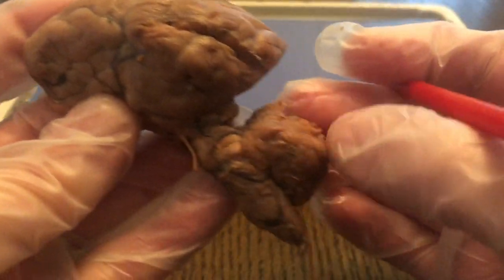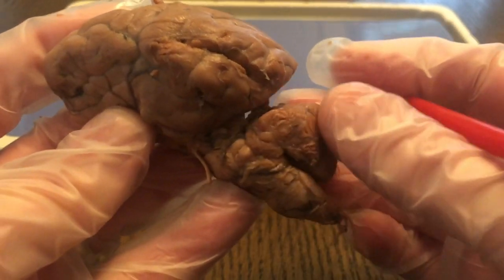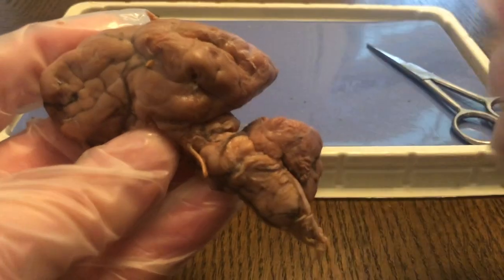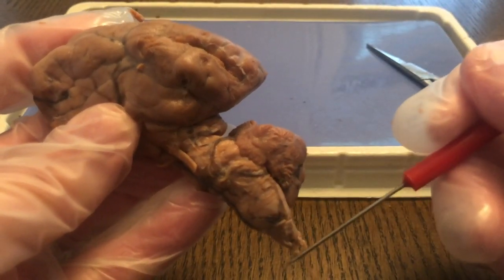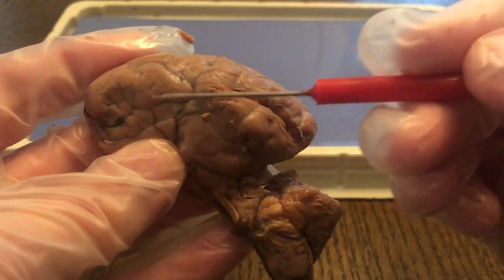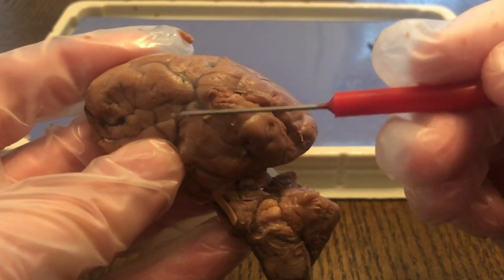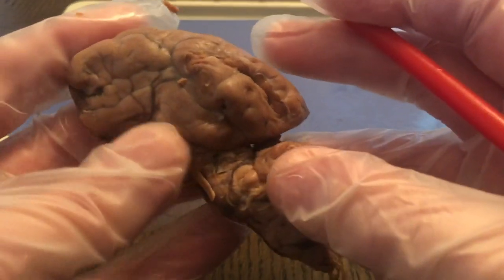Now, this is the outside of the cerebellum. The cerebellum is the posterior and more ventral part of the brain. And you can actually see the brain stem here, and then that leads to the spinal cord. Now, before we leave the cerebrum, there are different parts of the cerebrum controlling motor function, as well as sight, hearing, and olfactory response or smell.